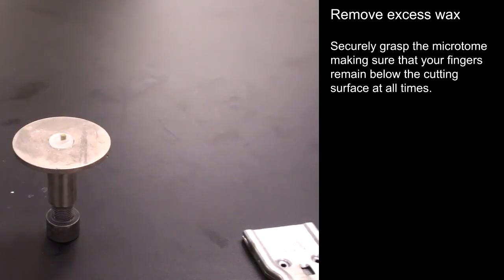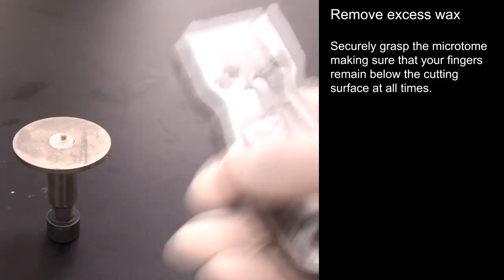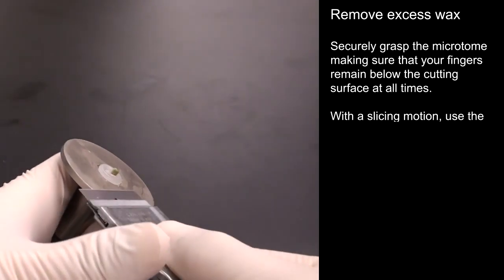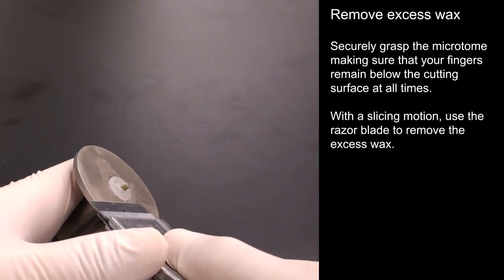Securely grasp the microtome, making sure that your fingers remain below the cutting surface at all times. With a slicing motion, use the razor blade to remove the excess wax.